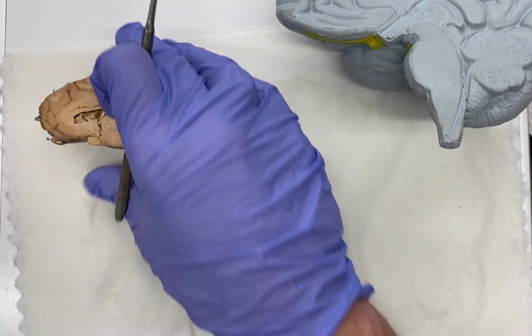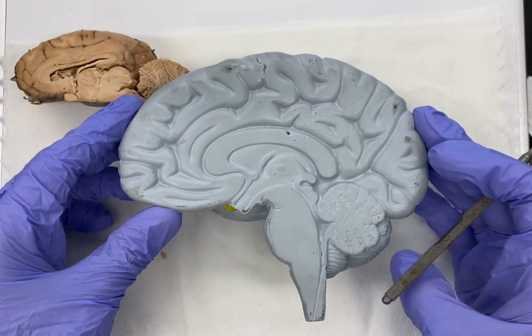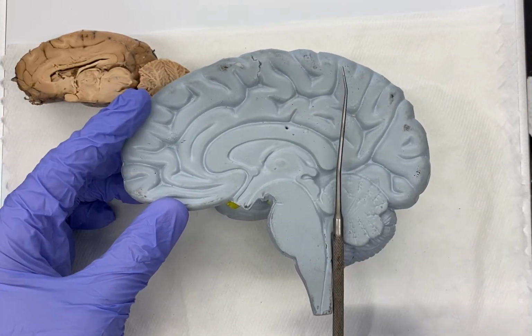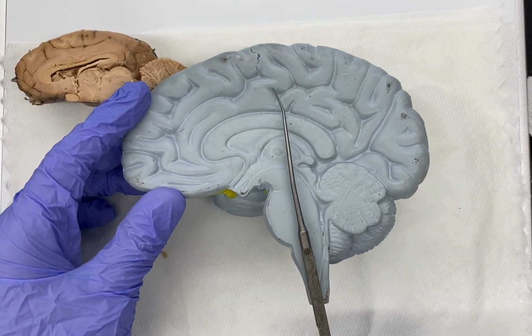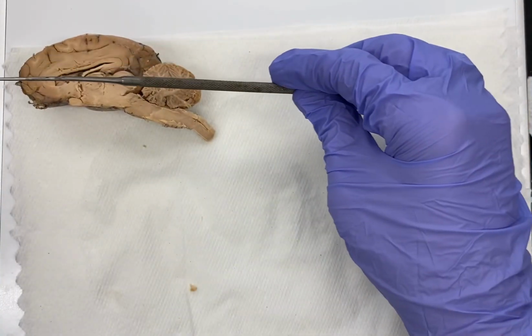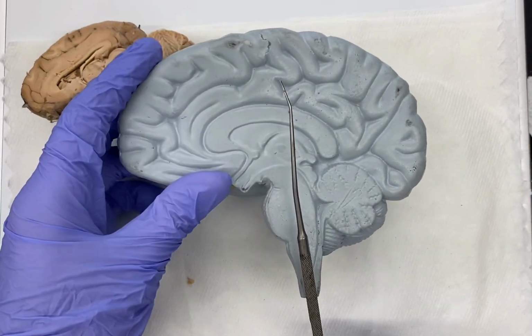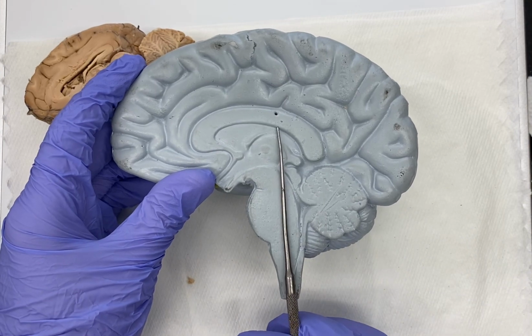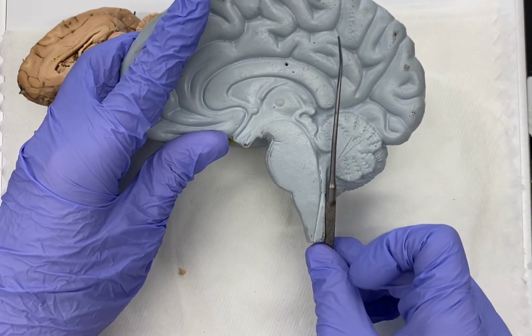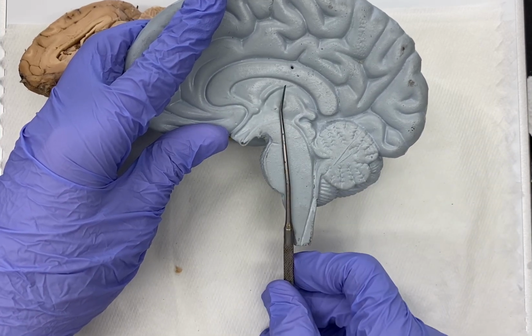Now, if we look at our human brain, we'll see that it's largely perpendicular to the orientation of the brain. So maybe here's the plane of our cerebrum, but then our brainstem and spinal cord is now oriented vertically, more perpendicular to the brain, whereas the sheep brain is coming out the posterior side, more horizontally oriented. With our human brain, it is oriented more vertically, and it's coming out the ventral surface, the bottom side of the brain, as opposed to coming out the back of the brain. So instead of coming out this way, it comes out like this.